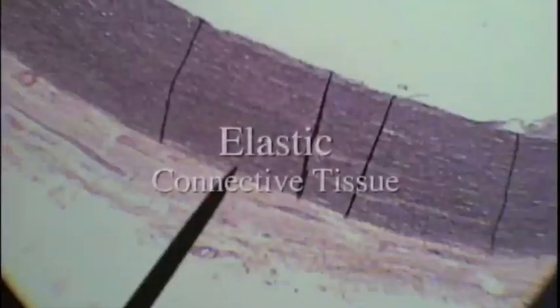This is not the regular pattern that we saw with dense regular connective tissue.